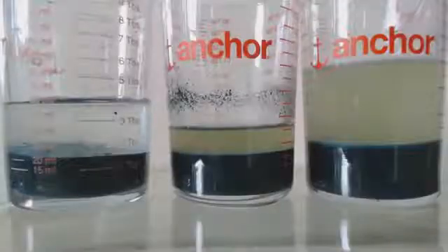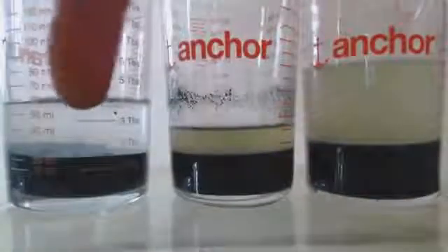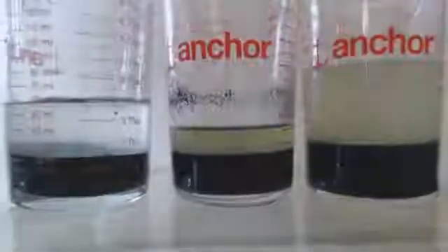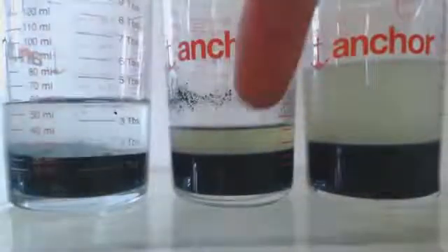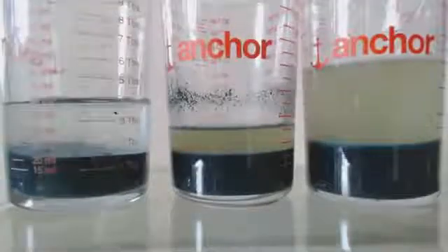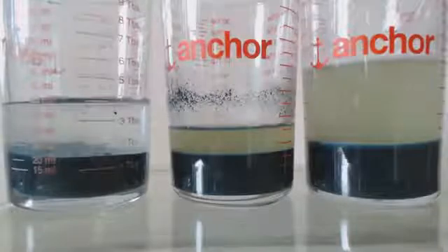I just want you to see the difference in comparison. The one on the left has just chromium hydroxide and water. I didn't let it sit for a while because it's so cloudy, but if you let it sit over a day, it'll definitely be clear as it can be.